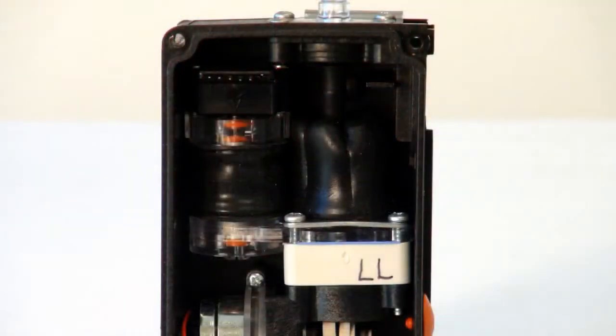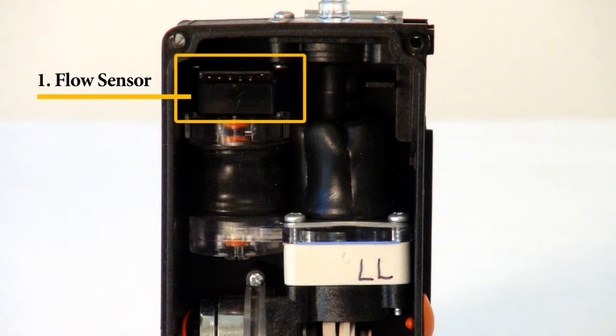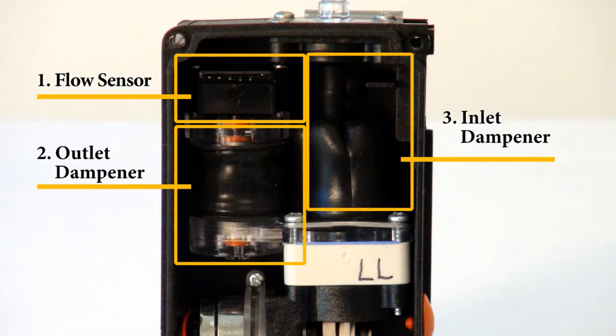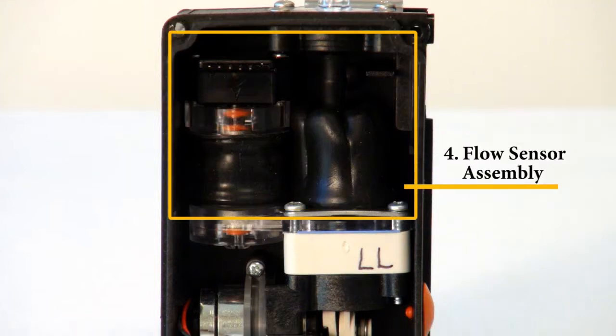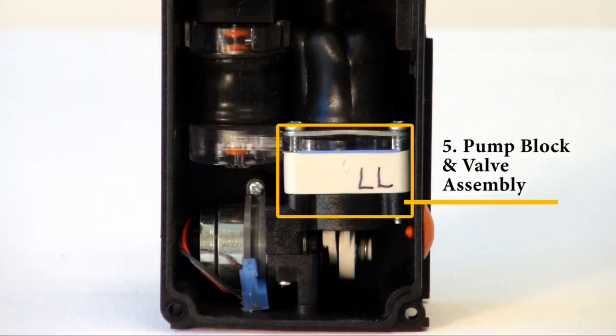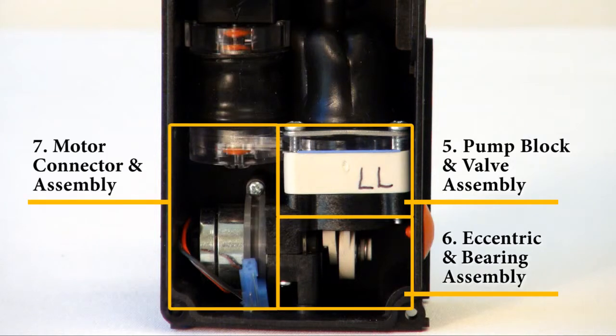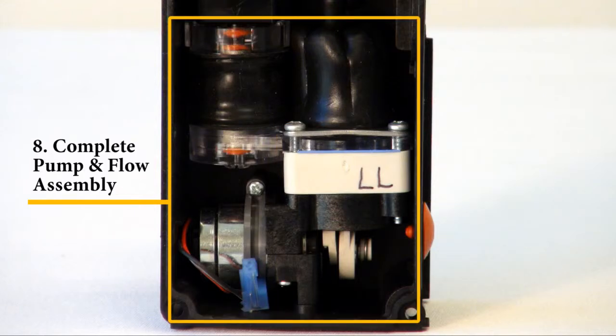The internal parts of the pump and flow assemblies are: flow sensor, outlet dampener, inlet dampener, flow sensor assembly, pump block and valve assembly, eccentric and bearing assembly, motor connector and assembly, complete pump and flow assembly.